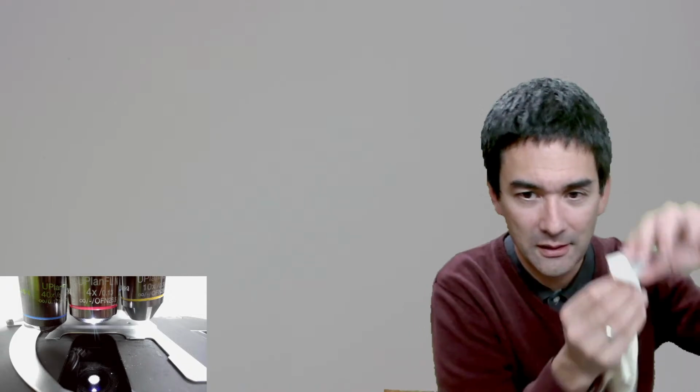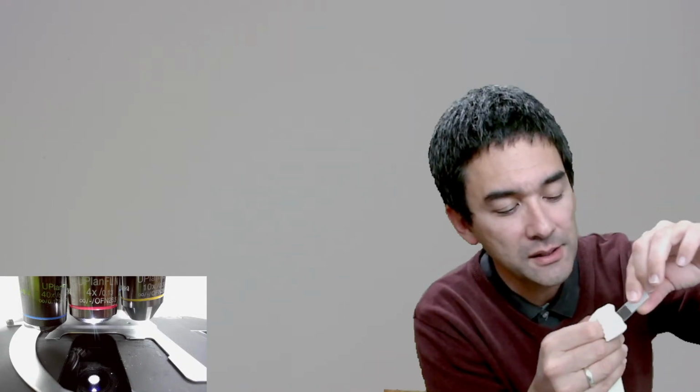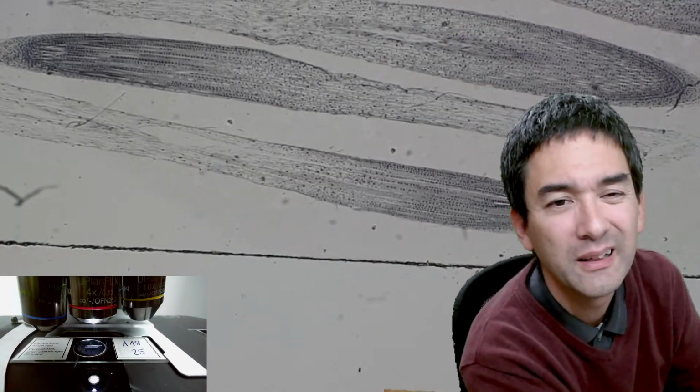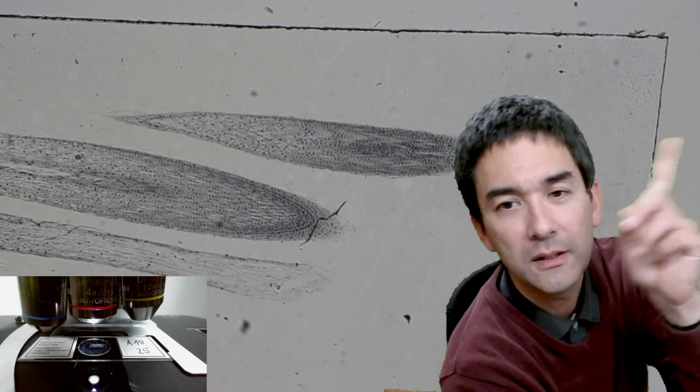So, look, I use those microfiber cloths, but sometimes the dust is not on the outside. Sometimes the dust is actually on the inside of the slide, if the company didn't make it very carefully. But I think it might be a little bit better now. It's a bit better.